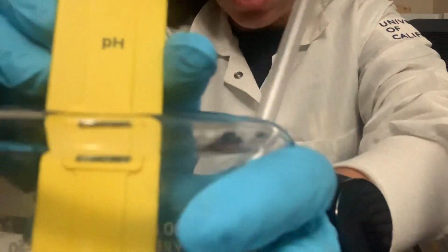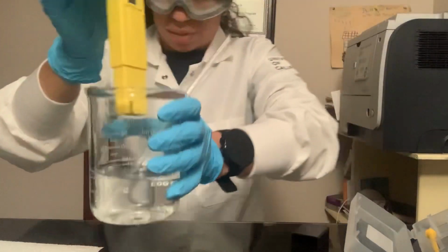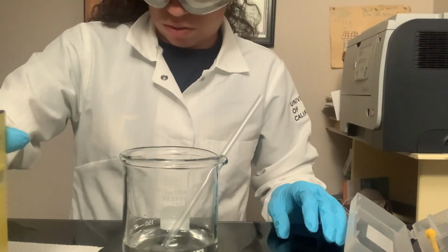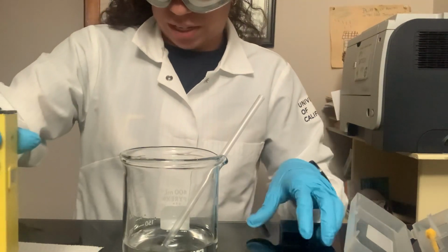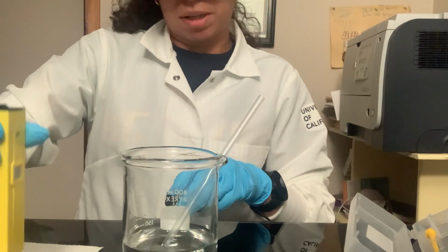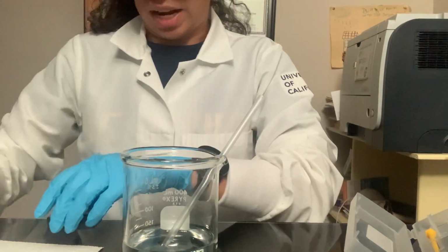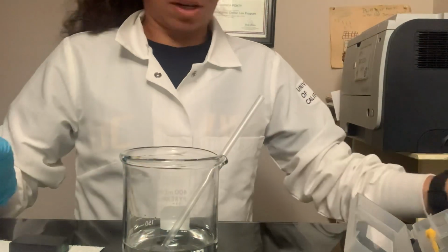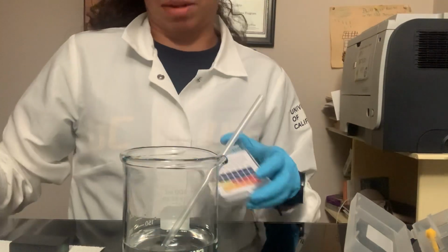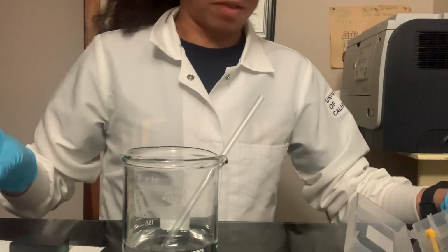You can't see it, but it should be about a 6.6, so that's our starting measurement. So we're somewhere between 6.6 and 7. These tools only estimate the pH, so it's not always 100% exact. On the first one I'm just matching colors, so it depends on your eyes, and this one has to be calibrated to a buffer solution.